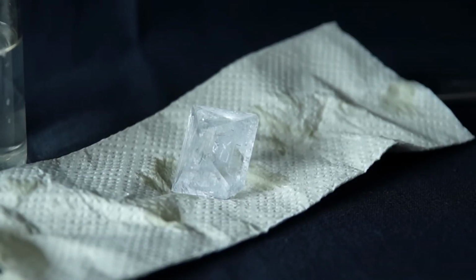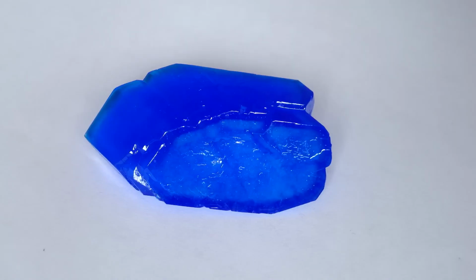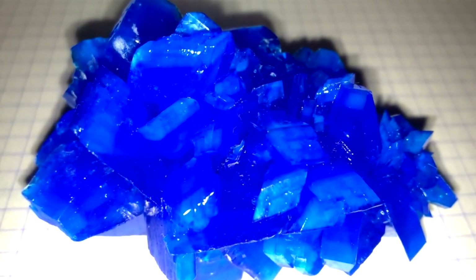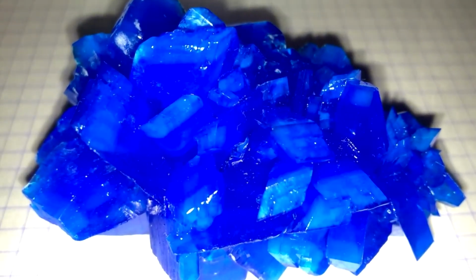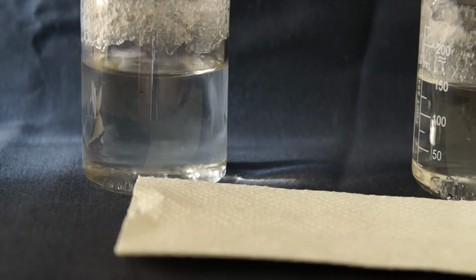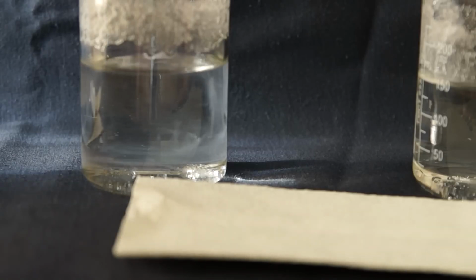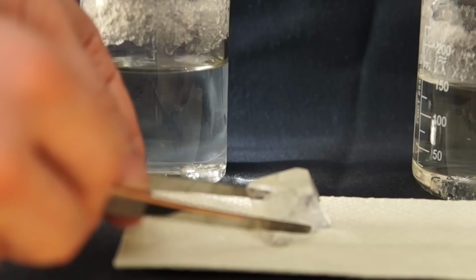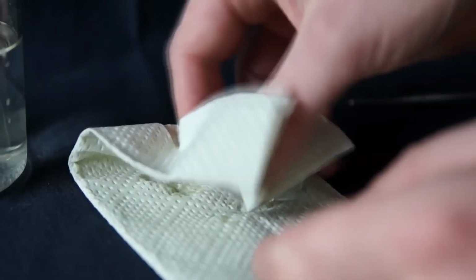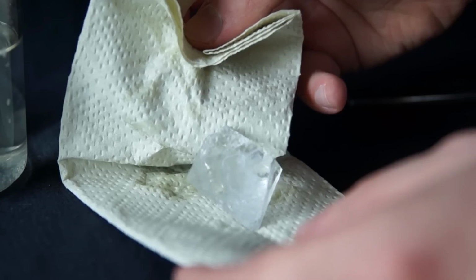For those who don't know, a single crystal is one large crystal, and a polycrystal is a set of crystals merged together during their growth. Once we have decided that our crystal is large enough and we want to stop its growth and put it on the shelf, we need to do some more steps. Let's take our crystal out of the solution and dry its surface using a cloth.